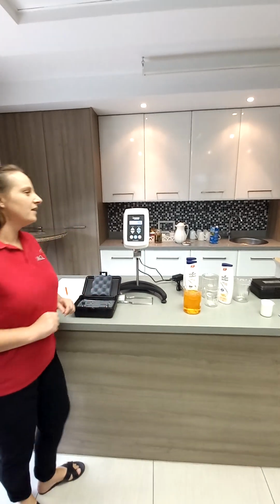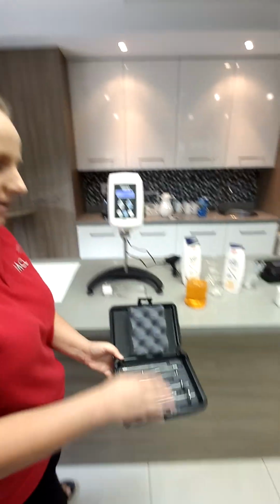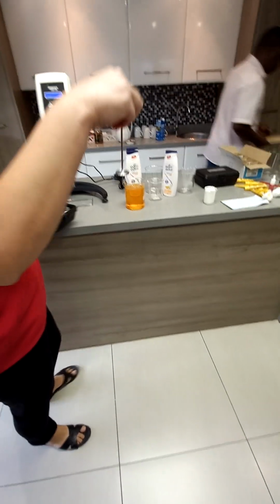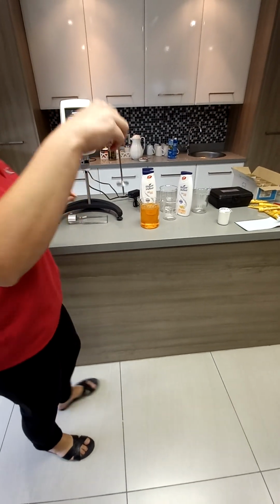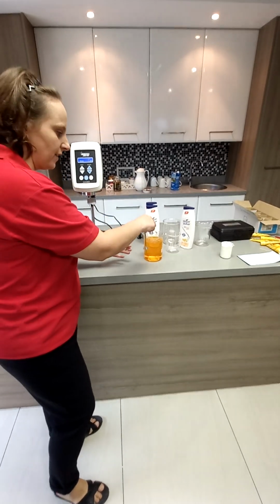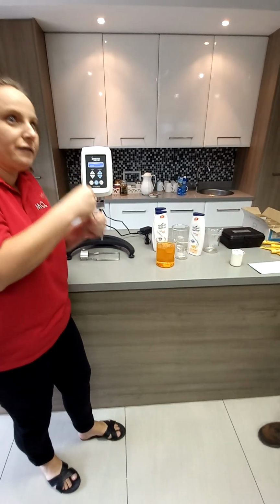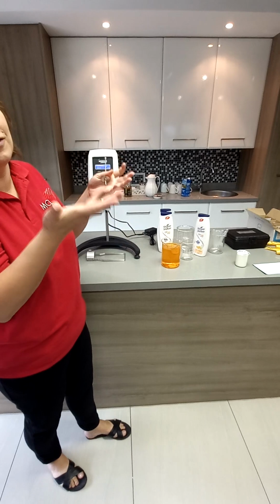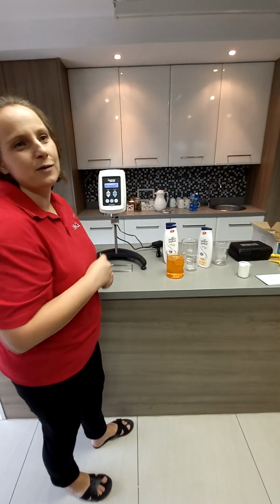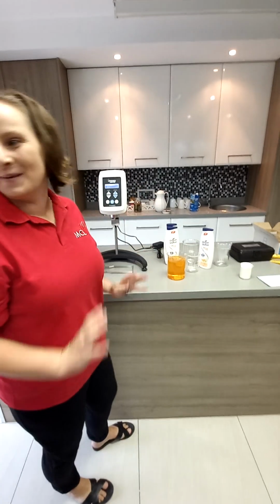So how the Brookfield viscometer works is, you'll see there's a set of spindles. We call them spindles. It's like this, and what it does, the unit rotates the spindle in your sample. The more viscous your sample, the more difficult it would turn, so it means your viscosity is much higher. The less viscous, the easier the spindle would turn. I'm trying to explain this in the most simple manner.